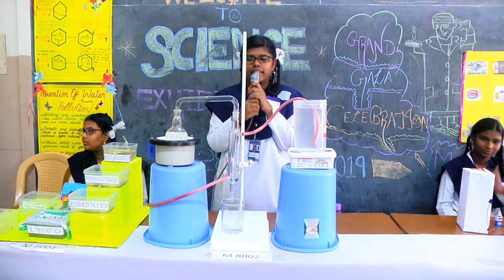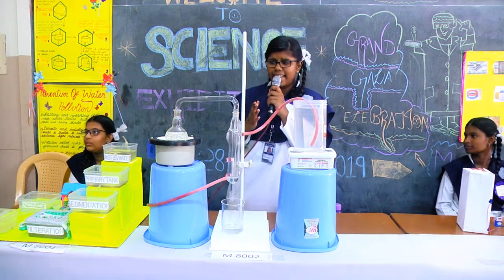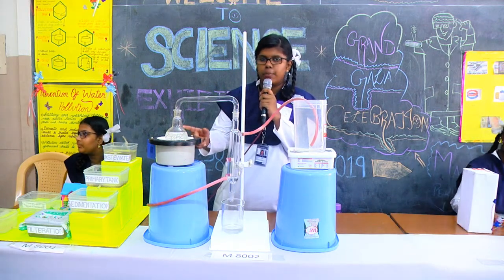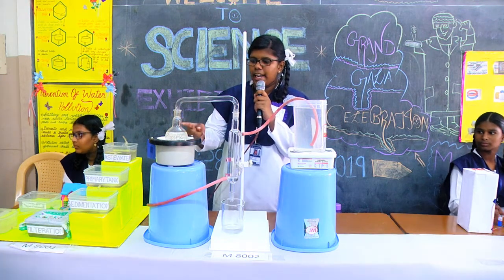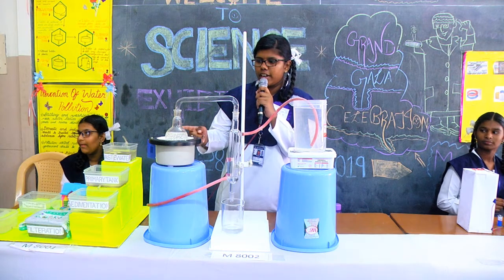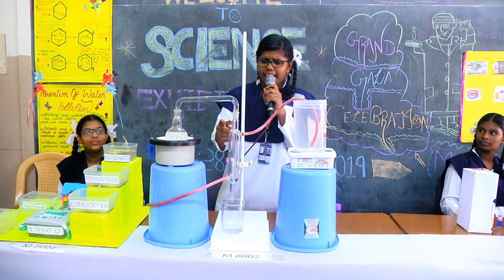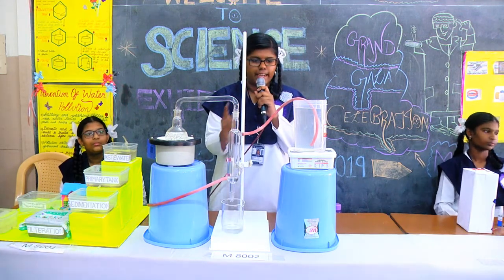Fractional distillation depends upon the boiling temperature or the boiling point of the liquid. Here I have taken normal distillation, and I have put in tap water which consists of some impurities. The boiling point of water is 100 degrees Celsius. When the water reaches its boiling point, it changes from liquid form into vapour, and it passes through this tube and into this condenser which consists of an inlet and outlet.